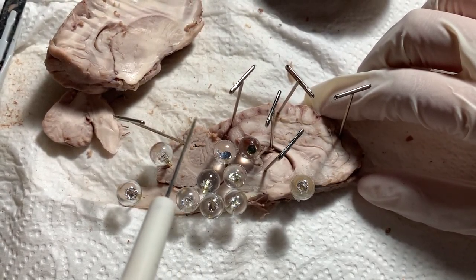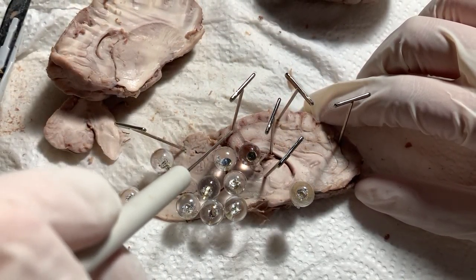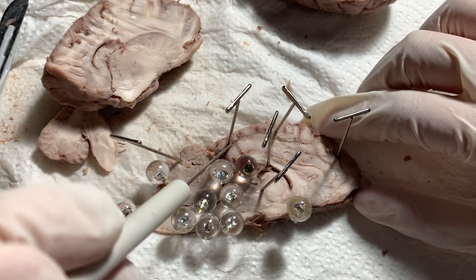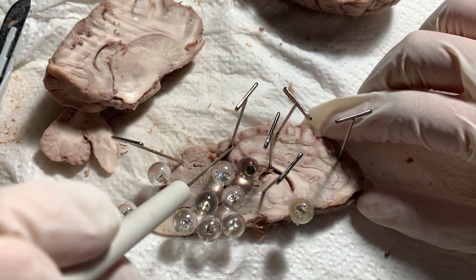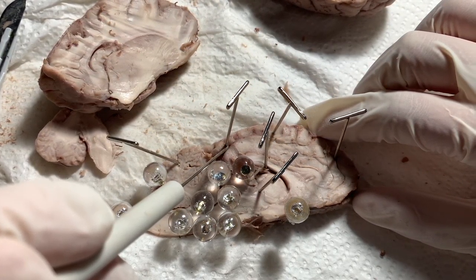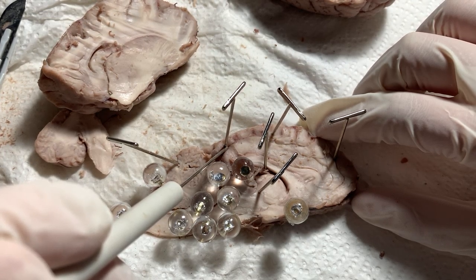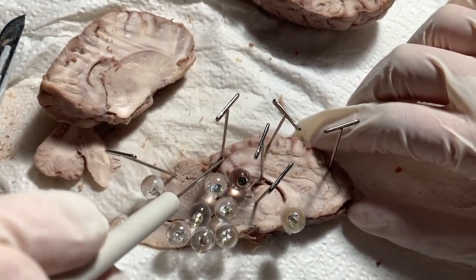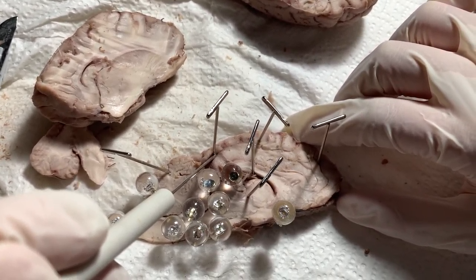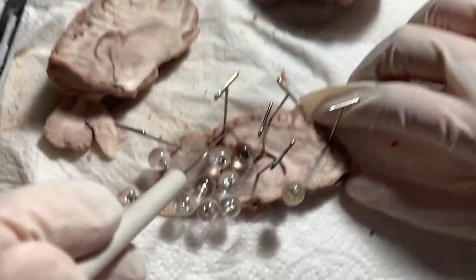Next we have the occipital lobe. The occipital lobe's function is to send signal from the primary visual cortex to the visual associative cortex. This helps with analyzing the visual information observed and retained as visual memories.